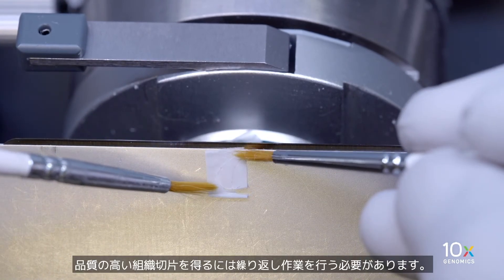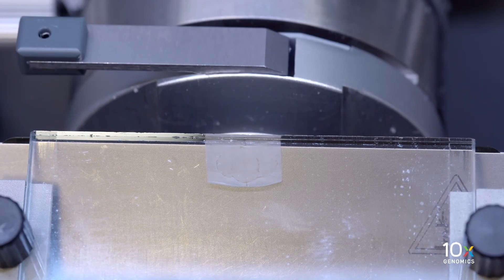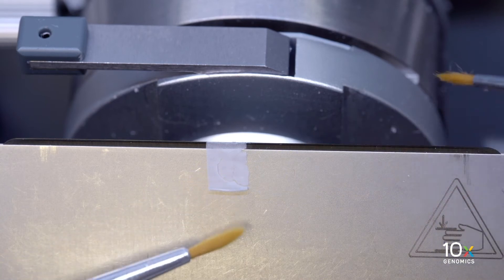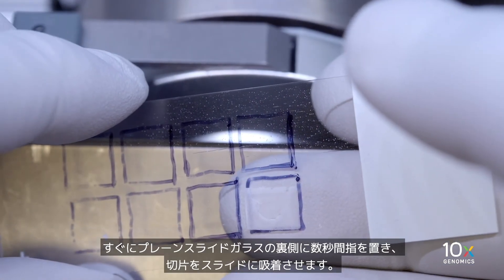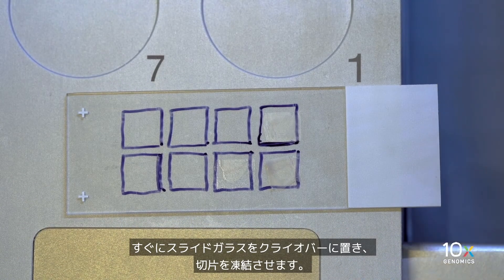It may take multiple attempts to obtain a high quality tissue section. Once the desired tissue section is obtained, carefully flatten it out by gently touching the surrounding OCT with cryostat brushes. Place the section in the trace box by gently touching the section with the slide surface. Immediately place the finger on the backside of the plain glass slide for a few seconds to allow the section to adhere to the slide.